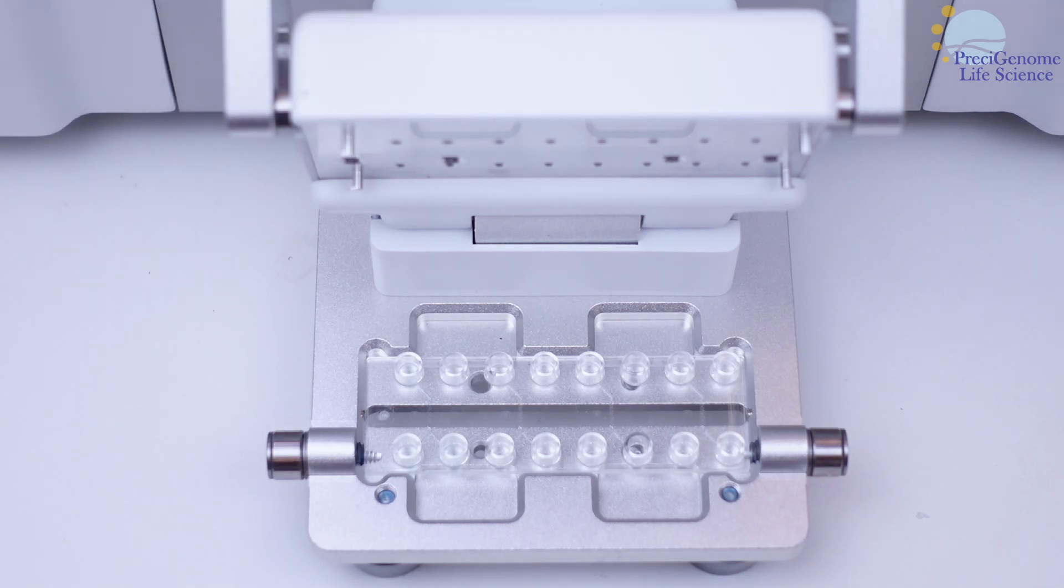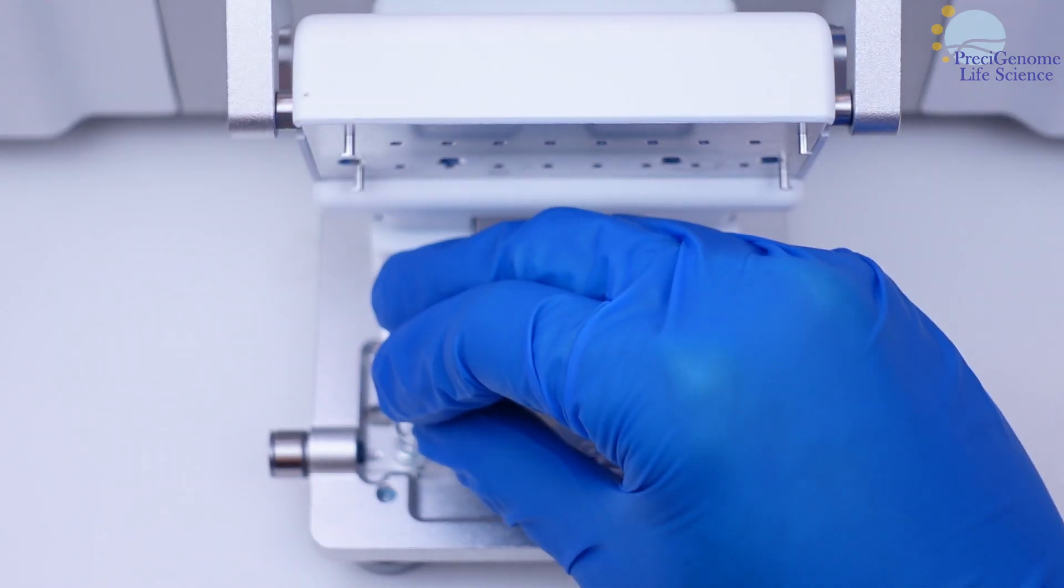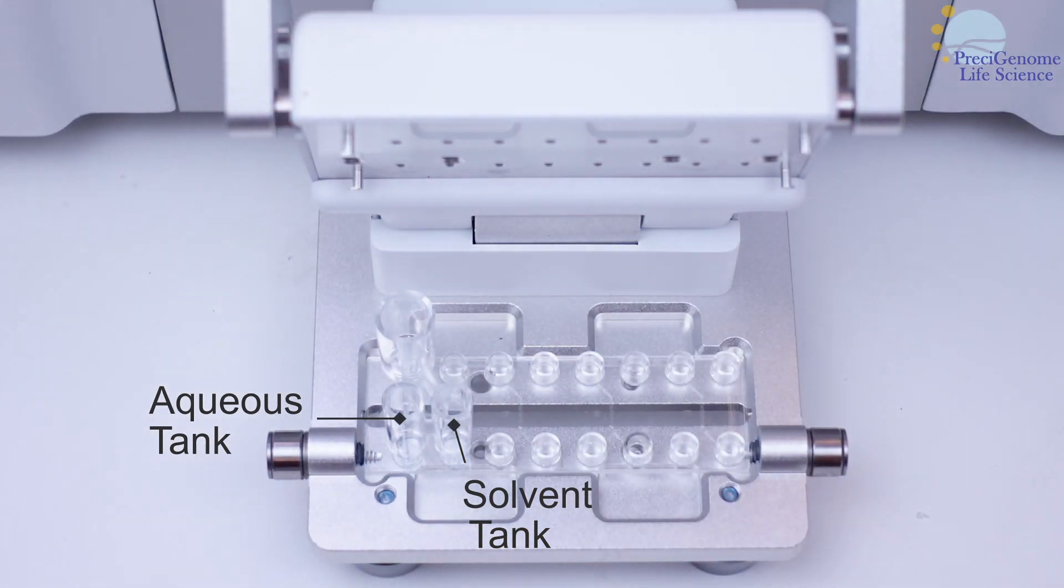The reservoir connectors consist of 3 tanks. The smaller paired ones are for reagents, while the larger tank is for collecting product.